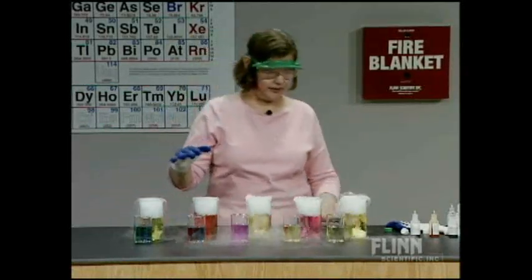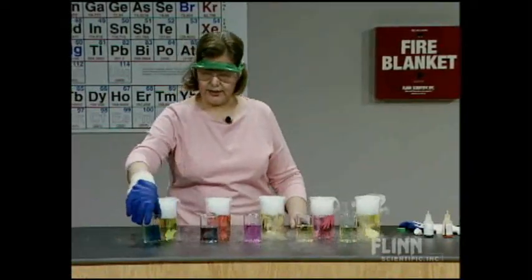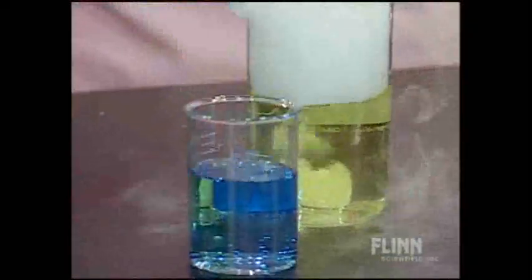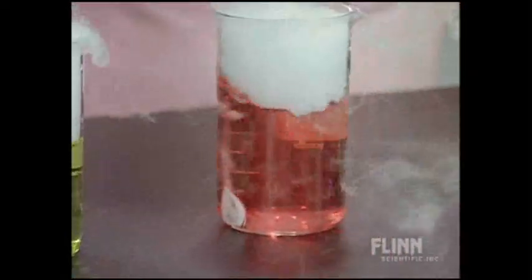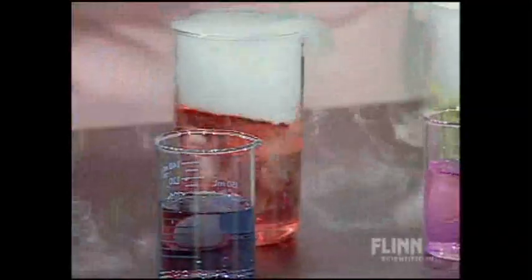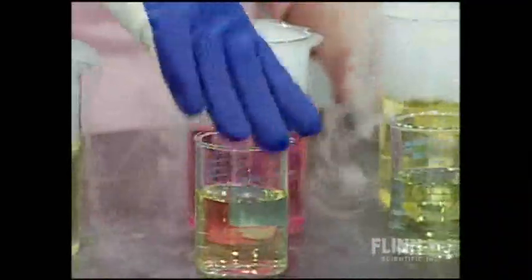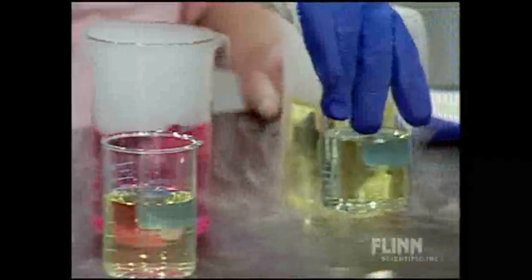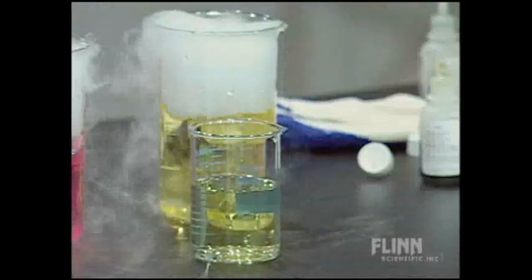In each of these cases, we did see a color change from the basic color. Bromocresol green was blue in base — the acid color is yellow. Universal indicator was a bluish-purple in base; in acid solution, it's a red-orange color. Phenol red was reddish-violet in basic solution and is yellow in acidic solution. Methyl red was yellow in base and red in acid. Finally, bromothymol blue was green — a neutral to basic color — and that turns yellow in acid.